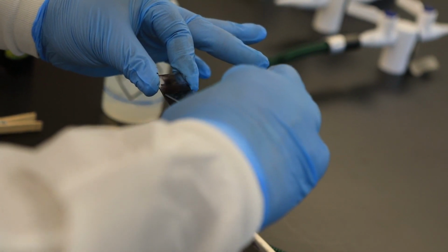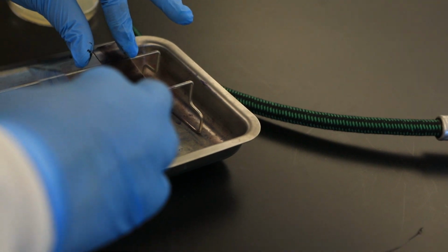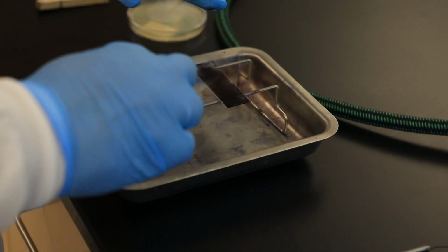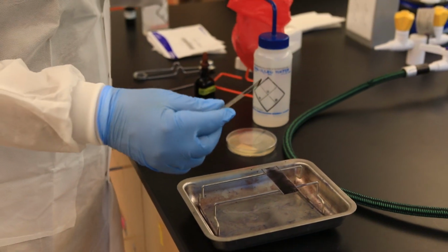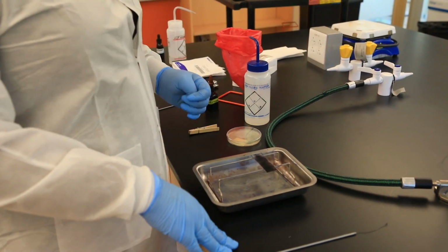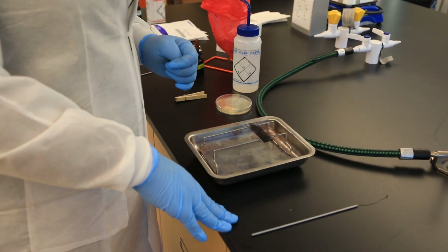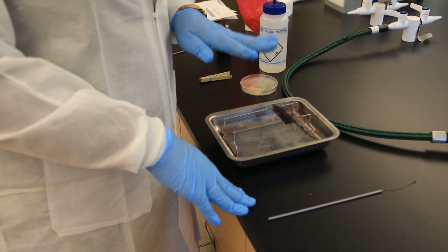Some like to do it with a clothespin. They think it's easier. I just like to do it like this. And once I spread it across, I lay it flat. What I'll do with this one is discard it into a biohazard bag there. And then what you're going to do next is be patient, unless you have something else to do, while you're waiting for this to dry. So this needs to properly air dry.